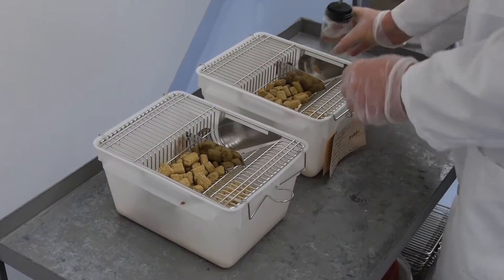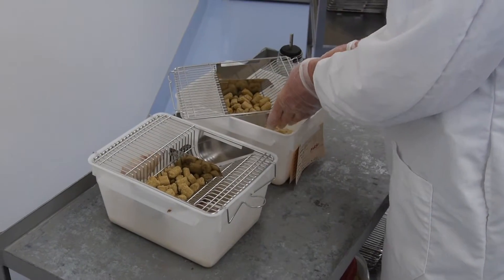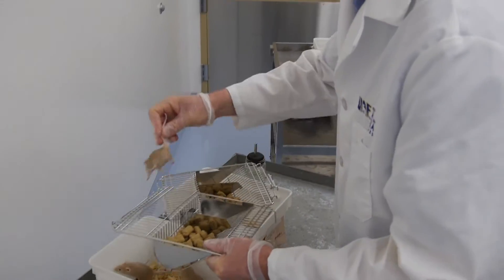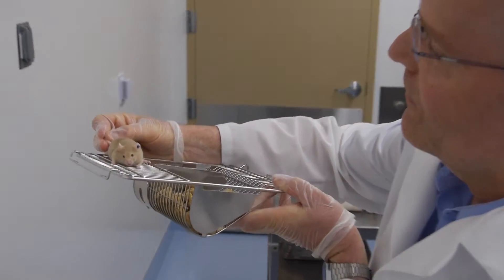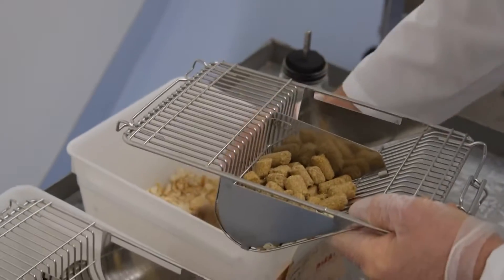In this instance, I show you that you can use the cage top as a support for the animal so that the animal is not hanging by its tail for a very long time. Here you can see I take it out, I put it on the cage top first, and then on the new cage top, and I lift it to be able to look at it to see whether it's healthy, whether there's any issues or anything like that.